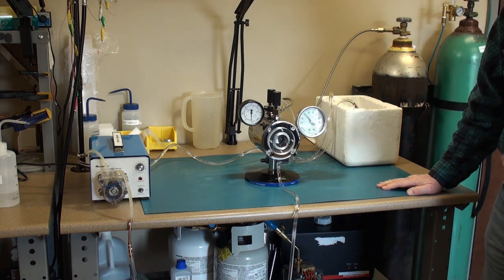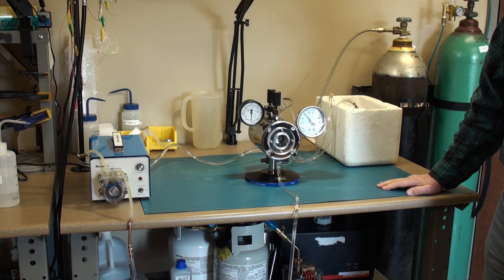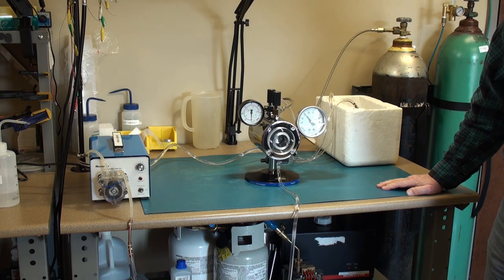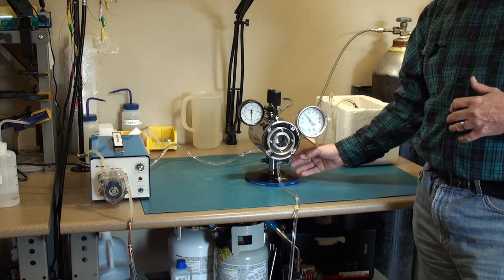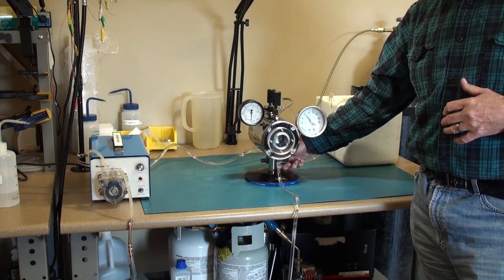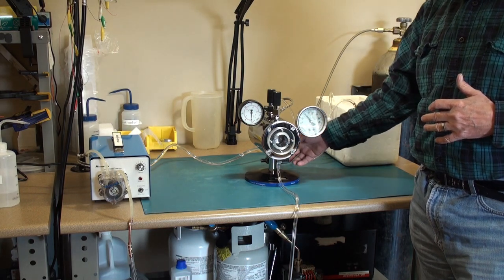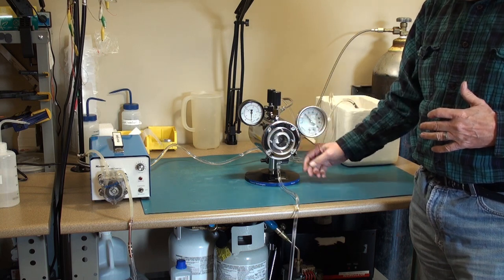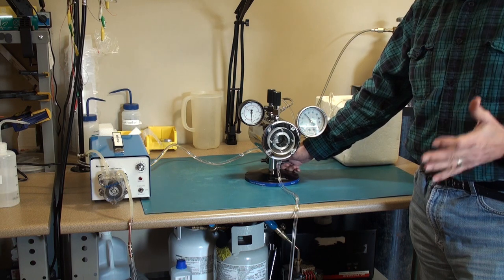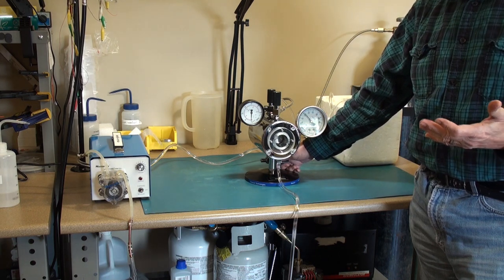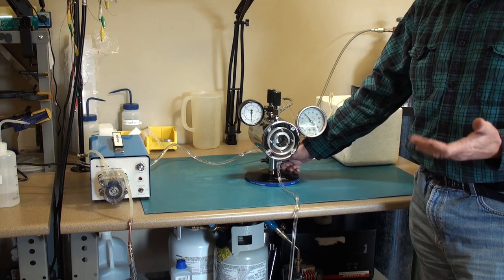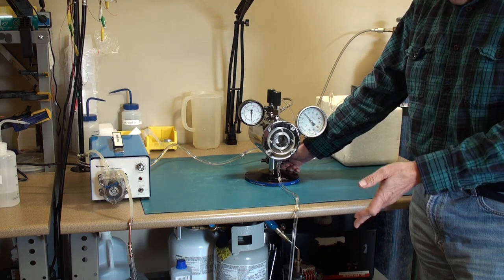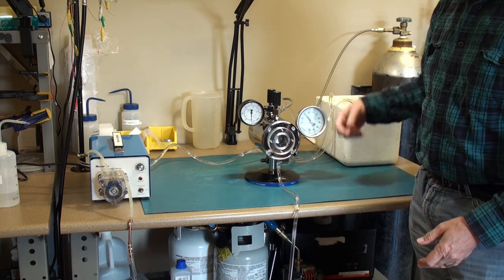Which should be about three quarters of the way up the sight glass is where I want it. Normally with an intermediate fluid you would do several, you would add some CO2, let the level come up, open the drain, releasing as much of the intermediate fluid, i.e. ethanol in most cases, into your collection bucket. Close the valve. Open it. Let some more CO2 in.